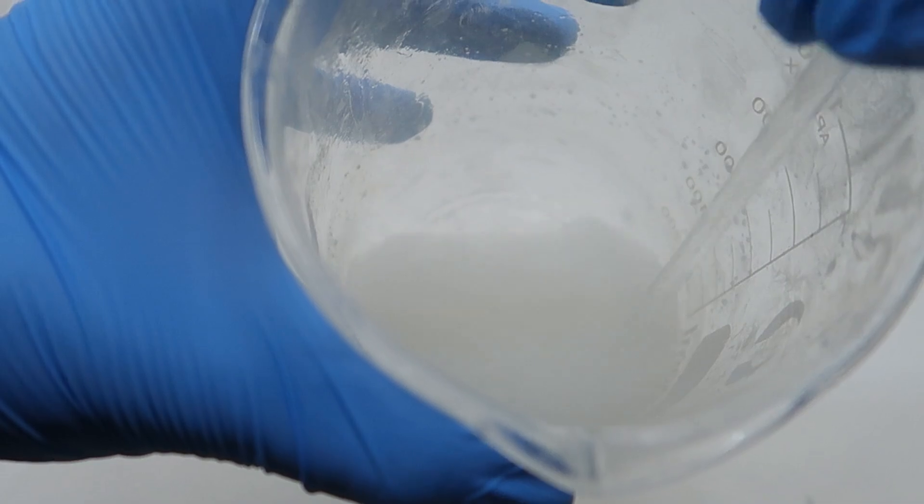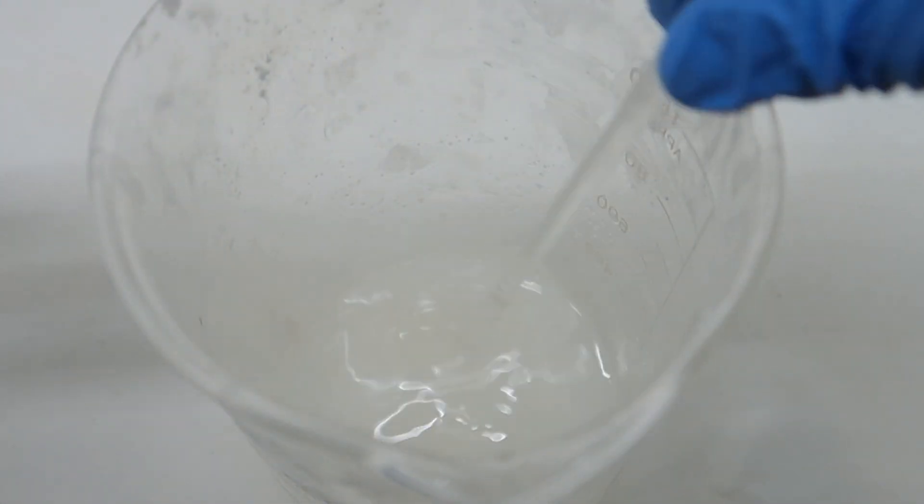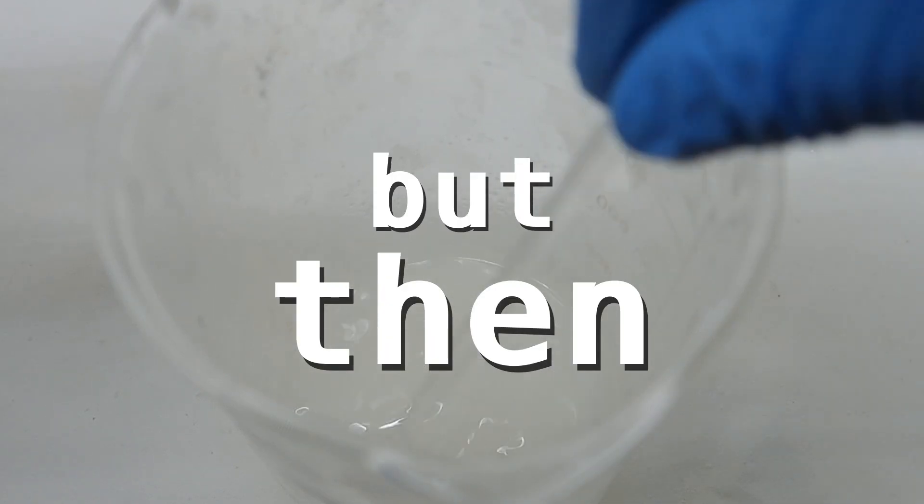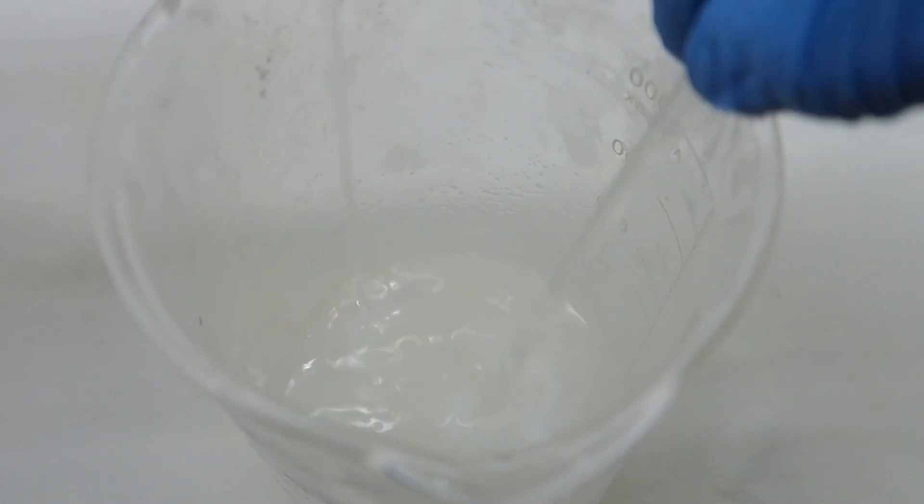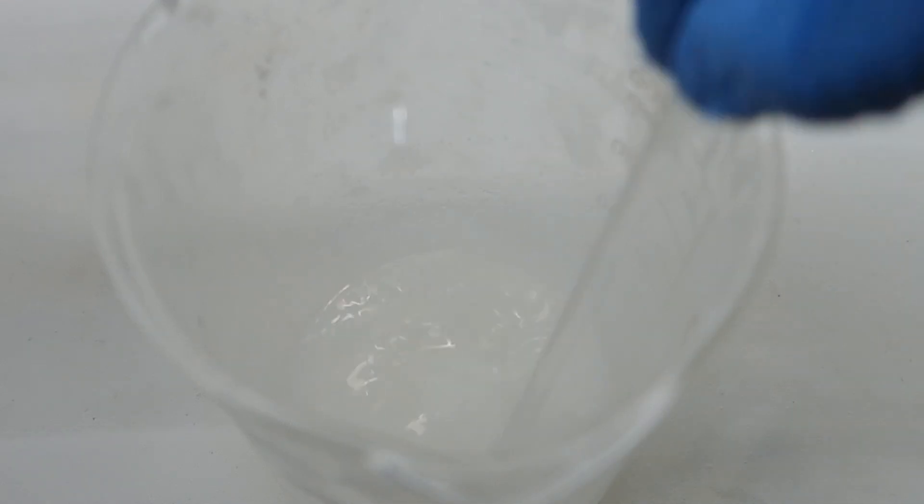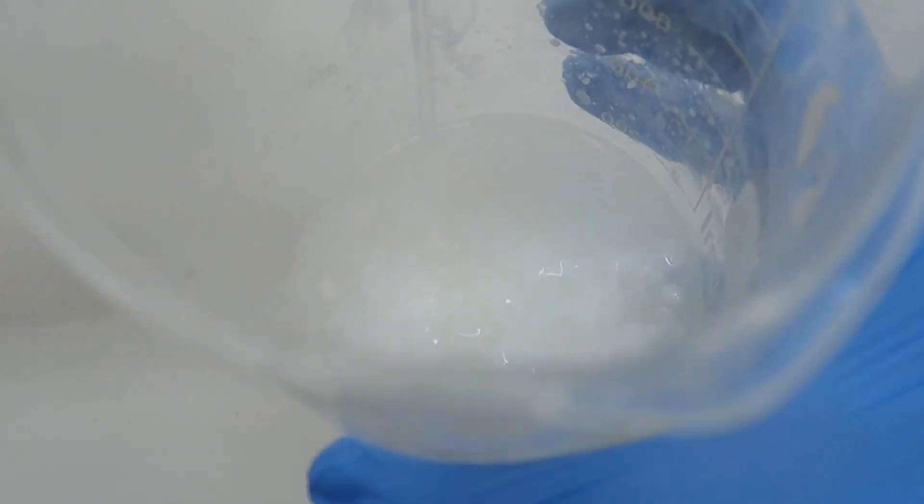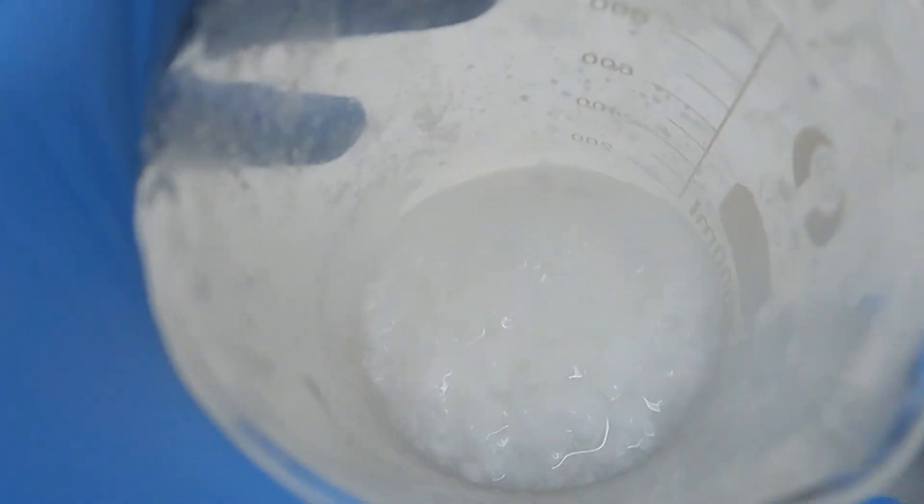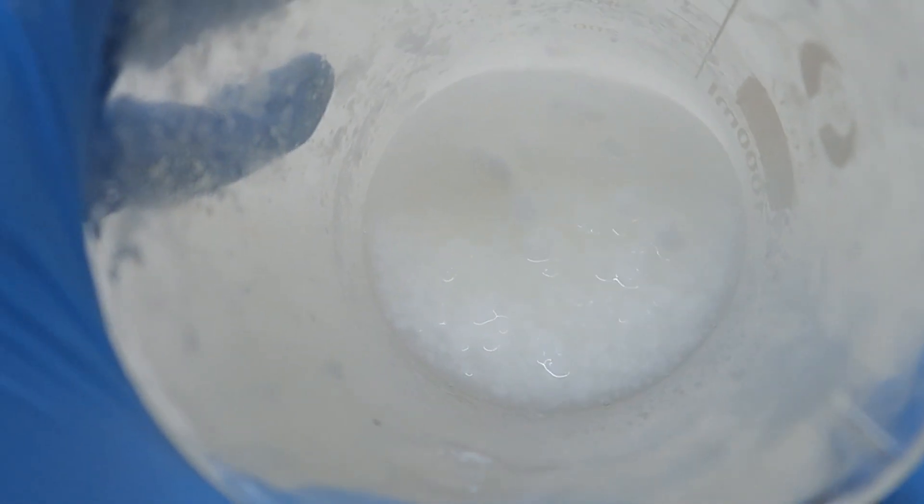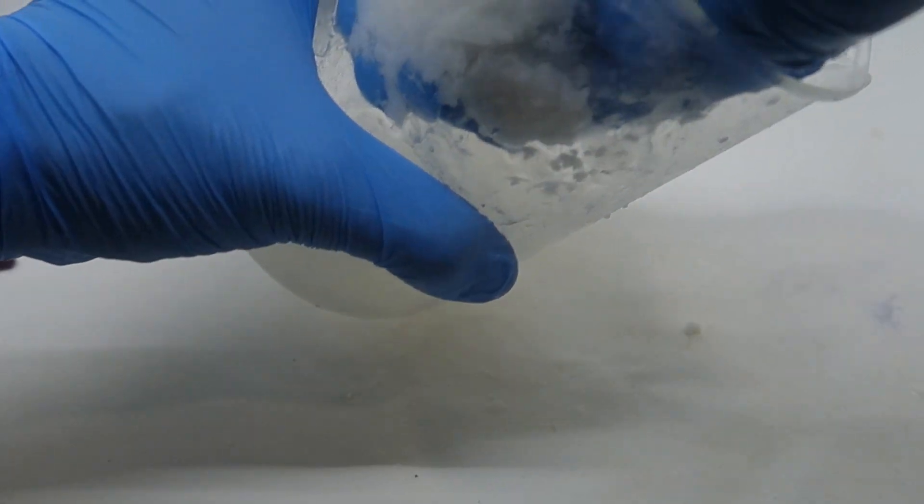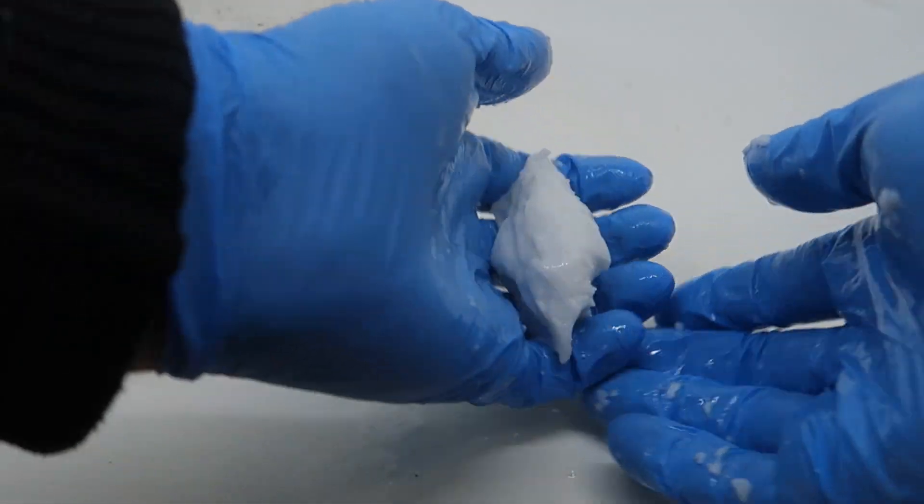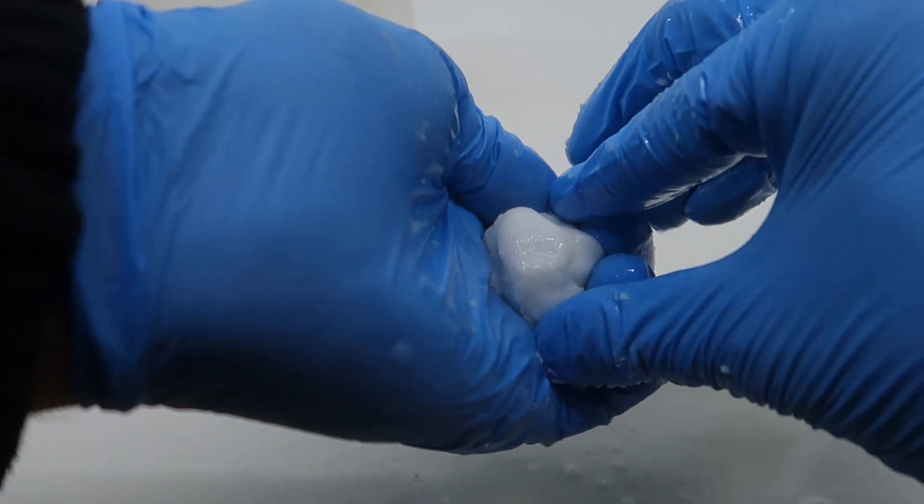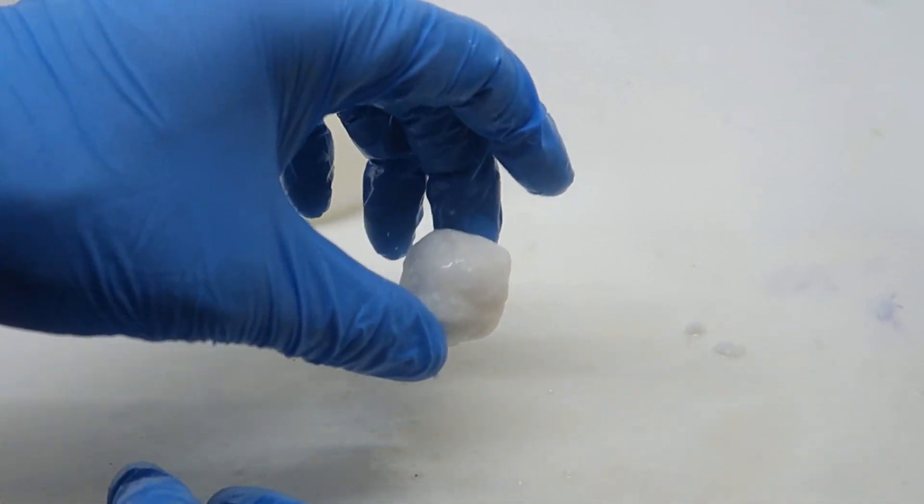Now, with just a little splash of ethanol, you see that the solution turns cloudy but remains liquid. But then, when adding some acid to it, the real magic happens. Okay, now hold on a second. I know what you think it looks like. I mean, I didn't really want to bring this topic to the table, but I kind of have to admit that, yes, it does look like a big cup full of cottage cheese, doesn't it? Anyways, now grab yourself a handful and give it a good squeeze. With some pressure, you'll be able to give it a good shape, and ta-da! This is our product!